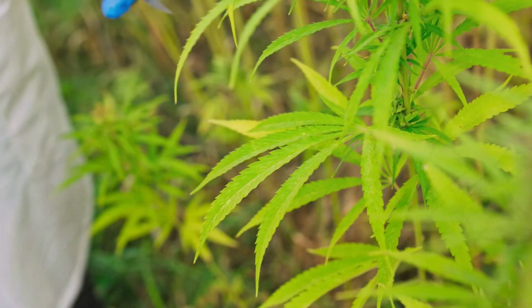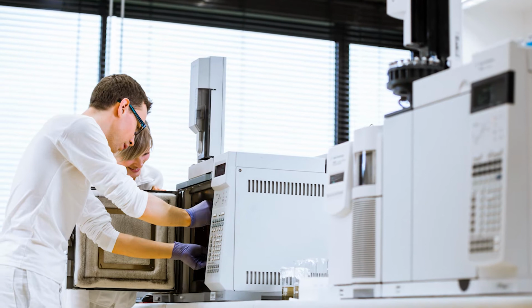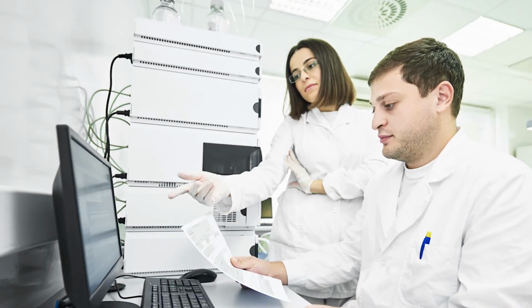This is a booming business for many small analytical laboratories. However, installing and operating a new software platform can be a challenge, as these labs are often owned and operated by individuals who do not have a background in analytical chemistry. The industry demands a fast, intuitive, and reliable software platform for data acquisition and analysis for HPLC and GC instruments.